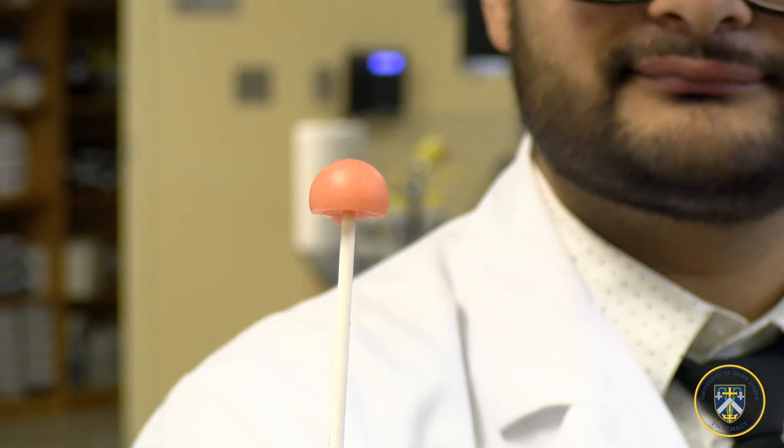If done correctly, this is your desired product. Note the even consistency and no breakage upon removing it. And there you have it, a Nystatin sorbitol lollipop.